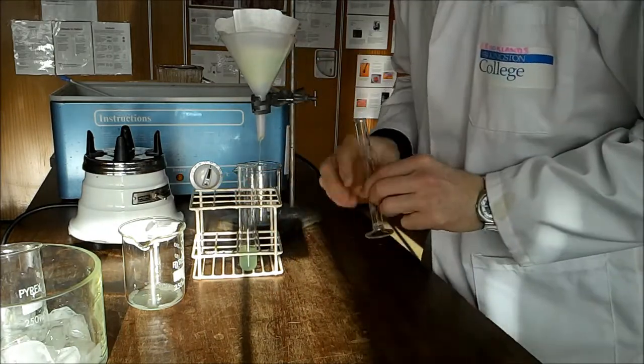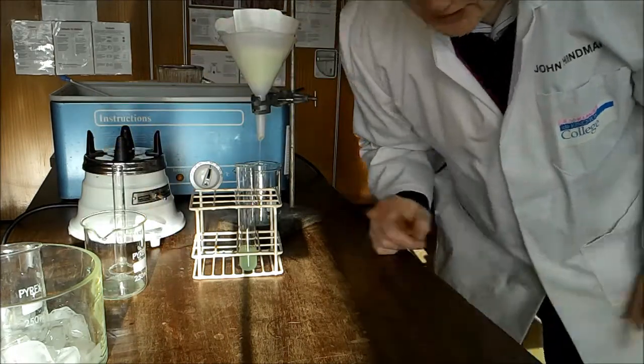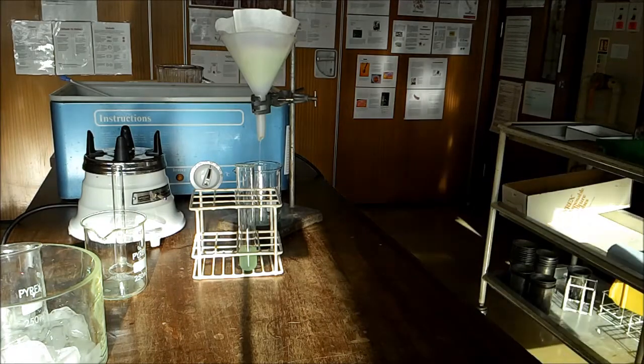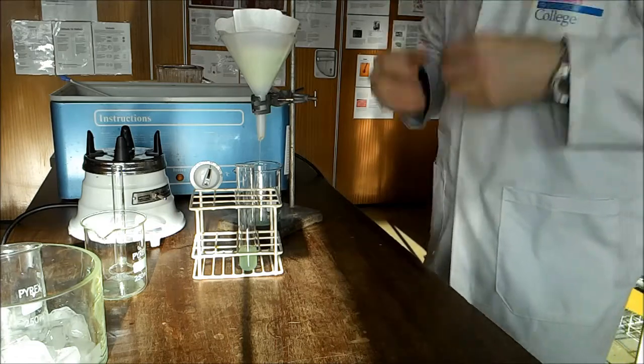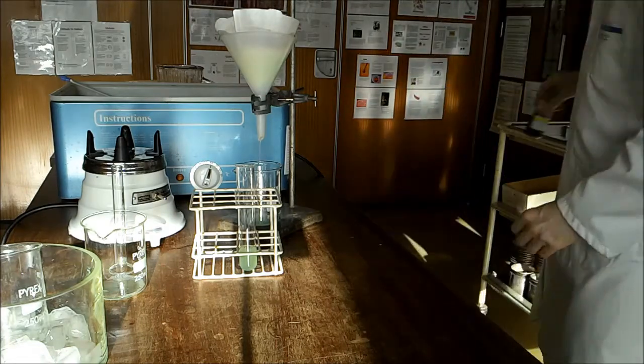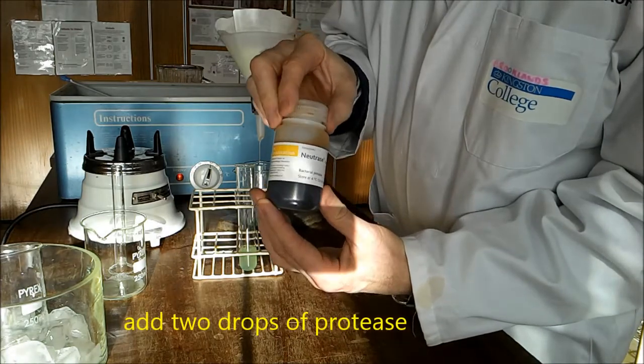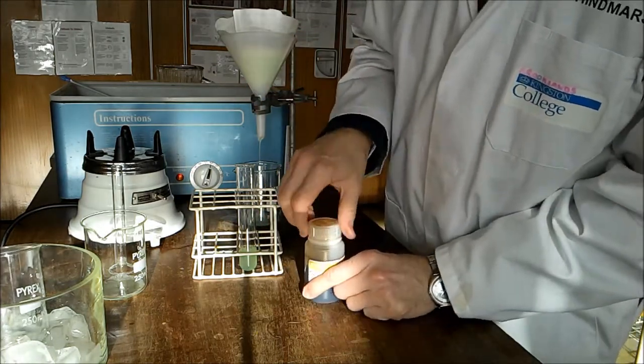You must make sure you wear eye protection for this procedure. The enzyme I'm going to use is protease. I need to add just a couple of drops.